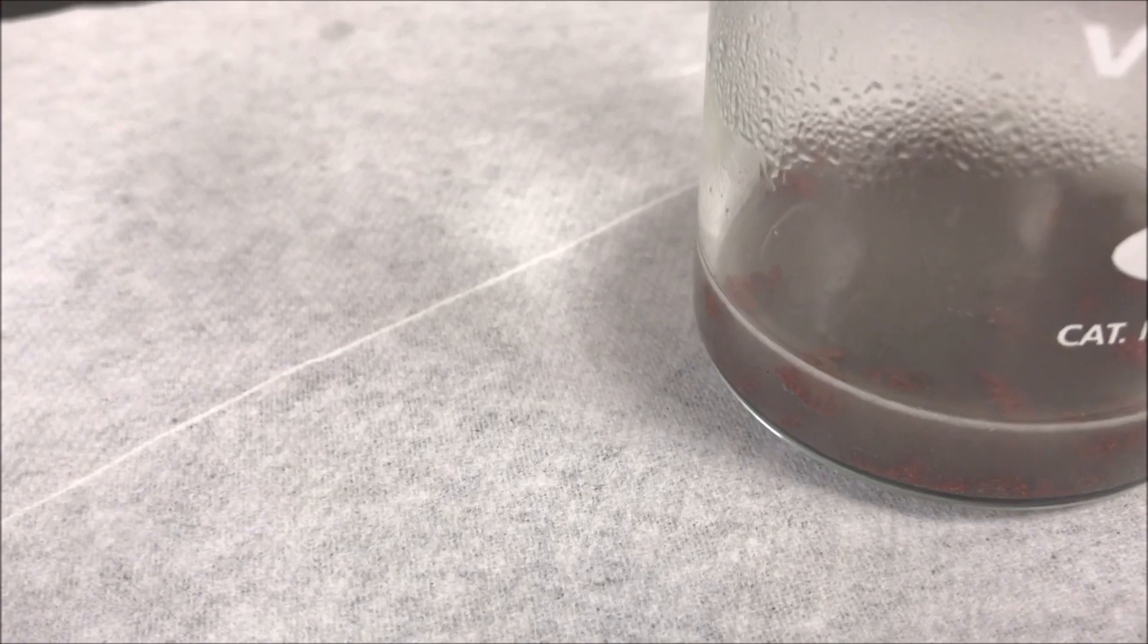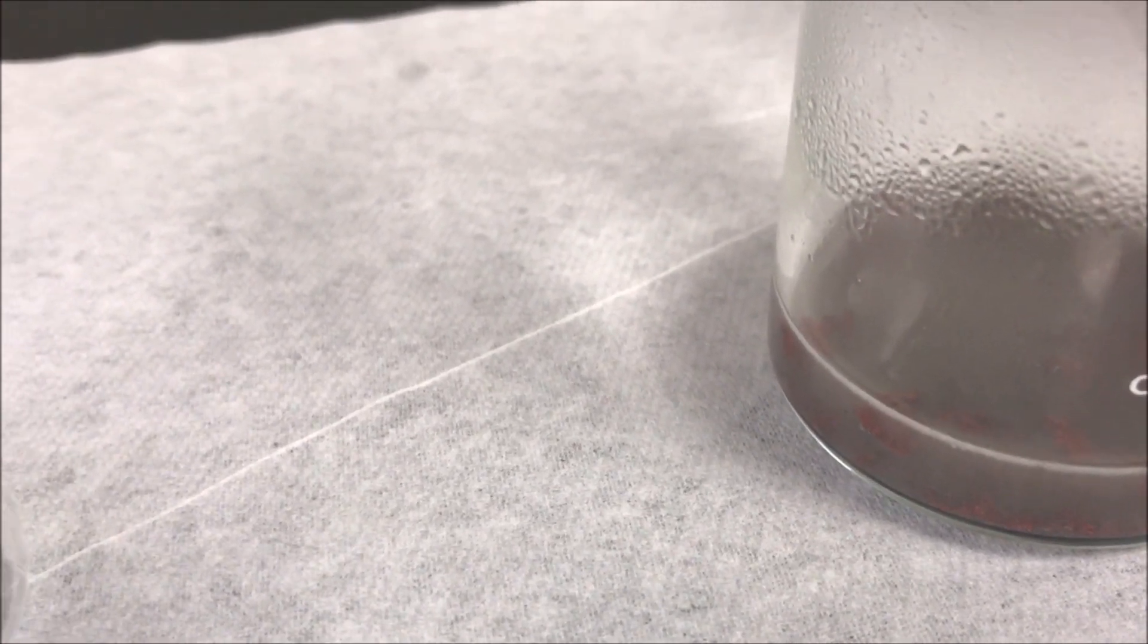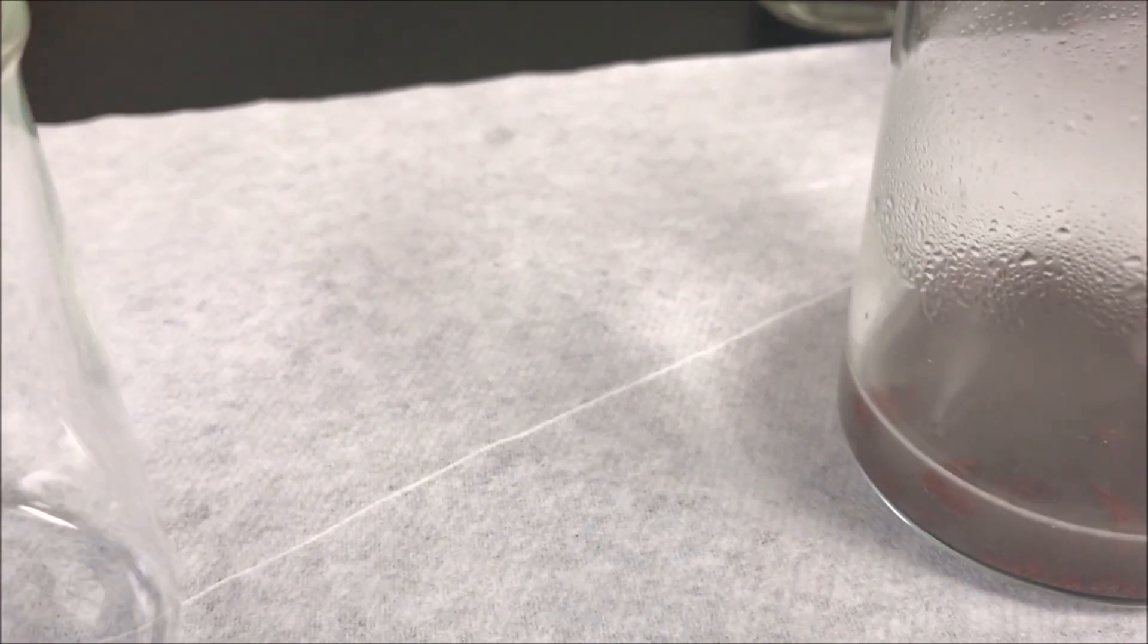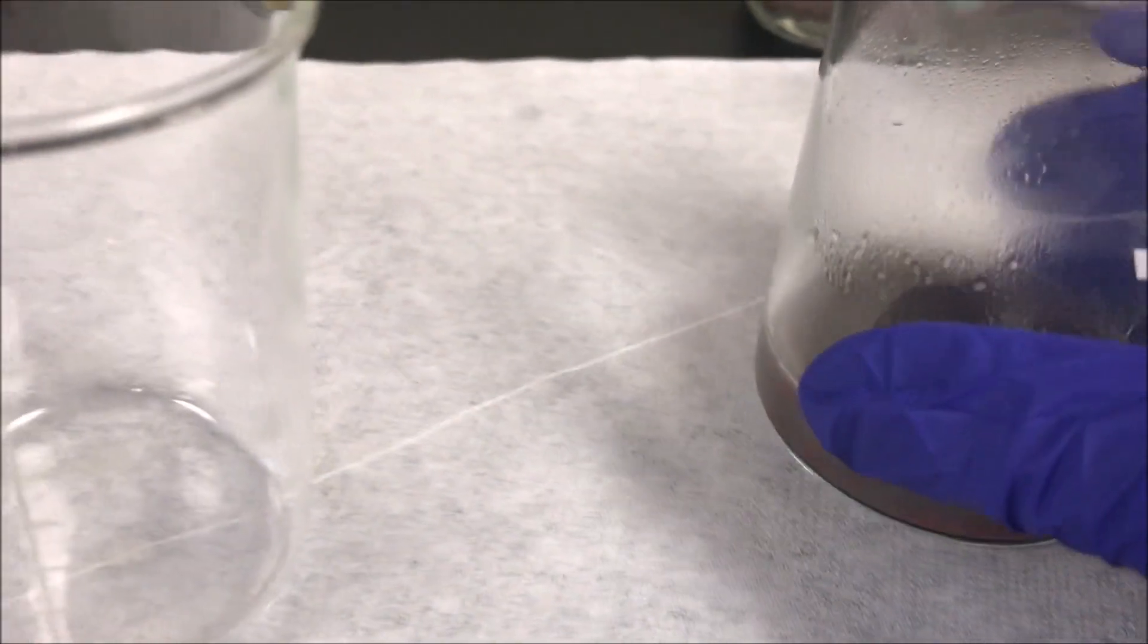After all of the aluminum foil has reacted, allow the solid particles of copper product to settle and carefully decant the solution from the solid. We are leaving behind the copper in the beaker.